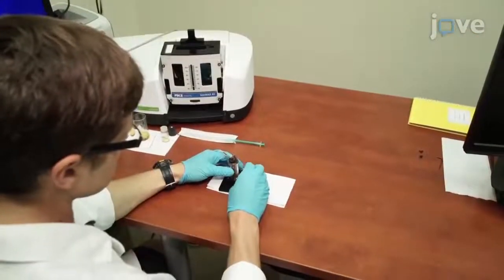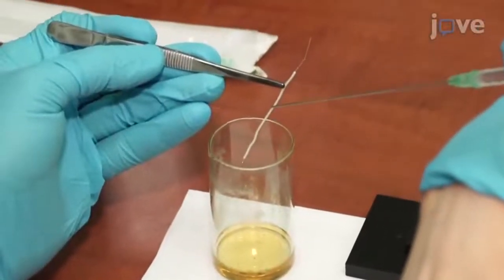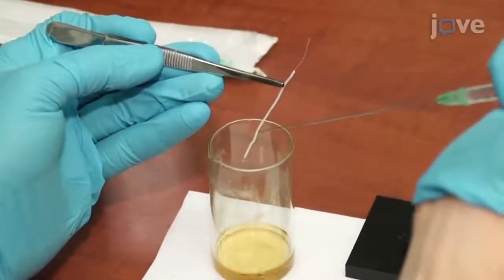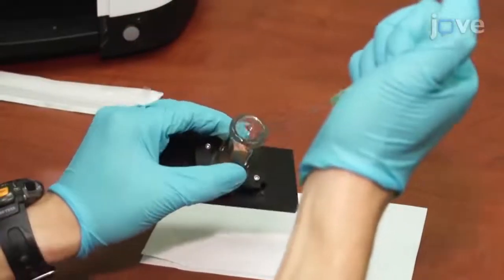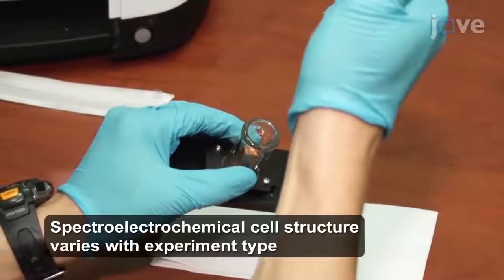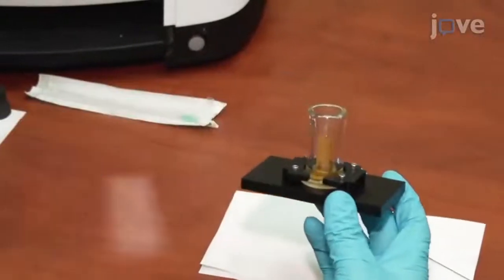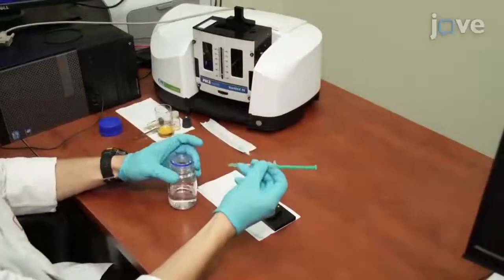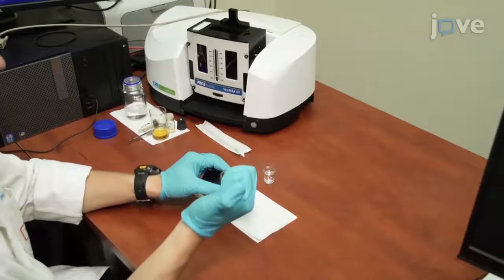Remove the reference electrode from its storage electrolyte solution and rinse it 3 times with the solvent to be used during the measurements. Clean the appropriate spectroelectrochemical vessel with ethanol, isopropyl alcohol, or acetone, and allow it to dry. Clean the other components of the cell with acetone and allow them to air dry for at least 1 minute.